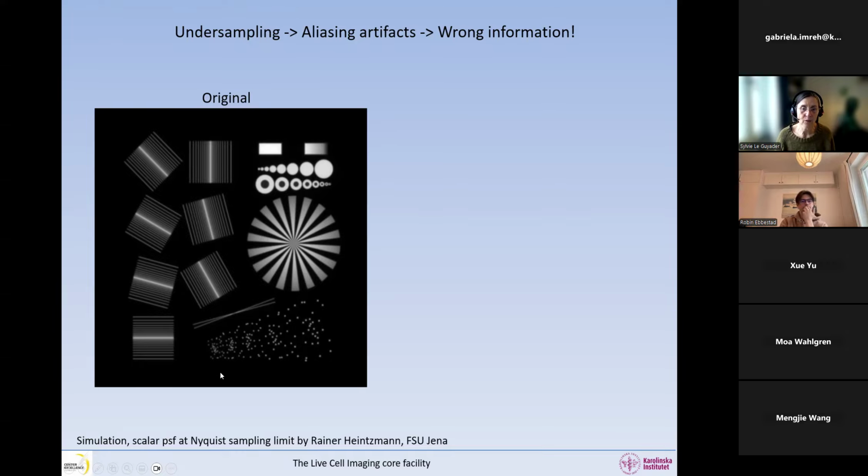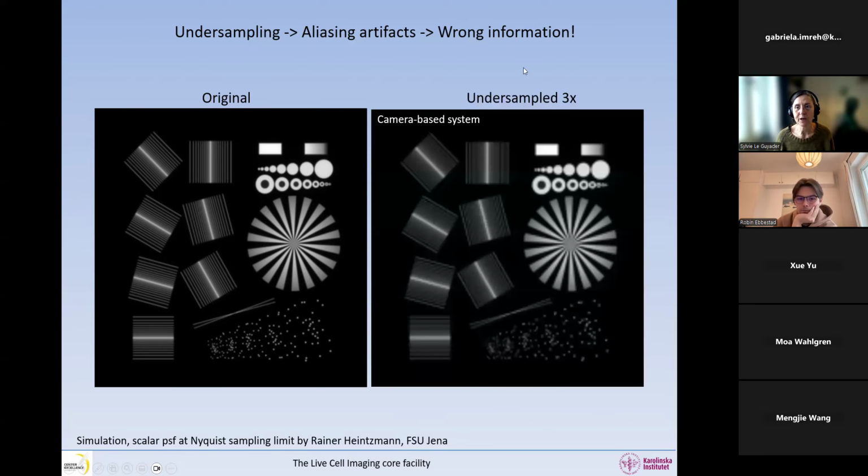And in here, we have some objects that look a little bit more like a biological sample. So in here, we have some random pattern of dots, okay? If we undersample 3 times, what do we see? And this is a camera-based system. We see that we get more artifacts that are visible. And then in here, everything is fused, right? Even though it was resolved, it is fused.